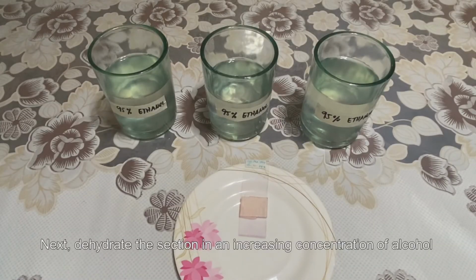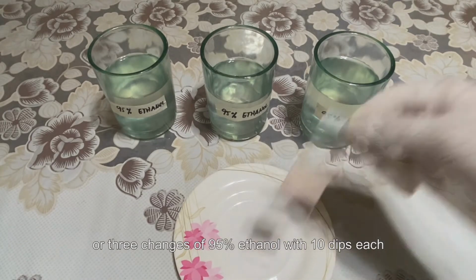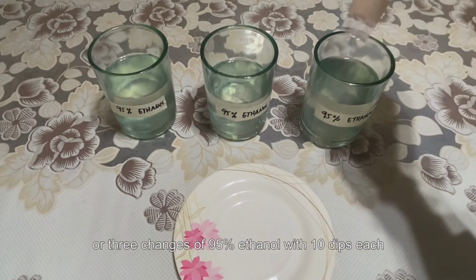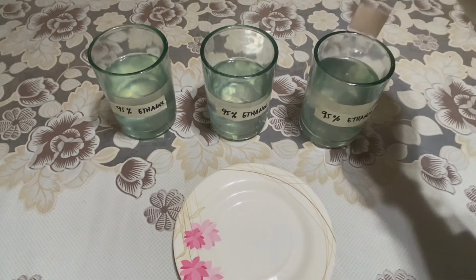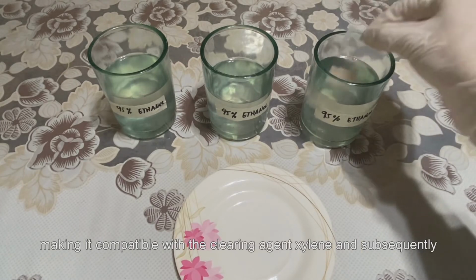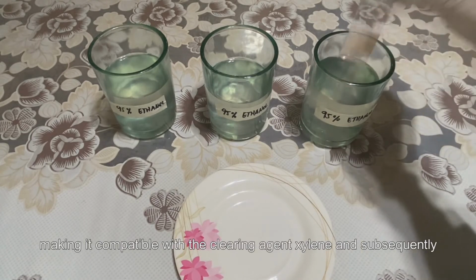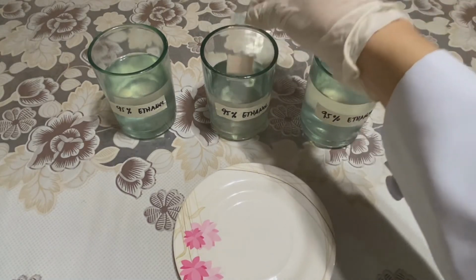Next, dehydrate the section in an increasing concentration of alcohol or 3 changes of 95% alcohol or ethanol with 10 dips each. This will remove excess water from the section, making it compatible with the clearing agent xylene and subsequently with the mounting media.